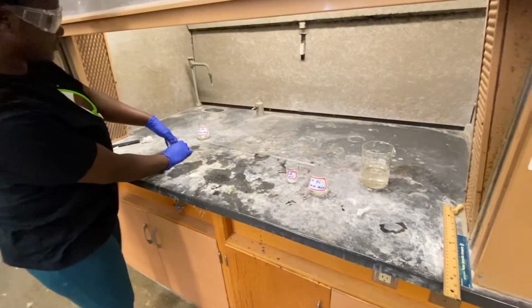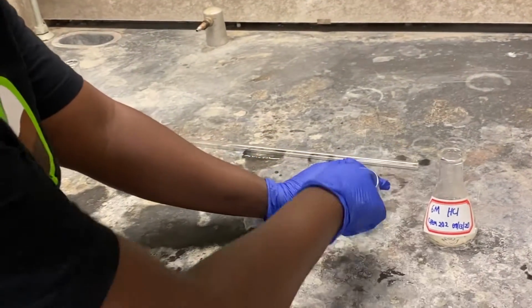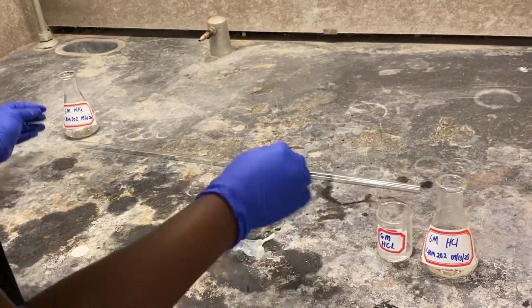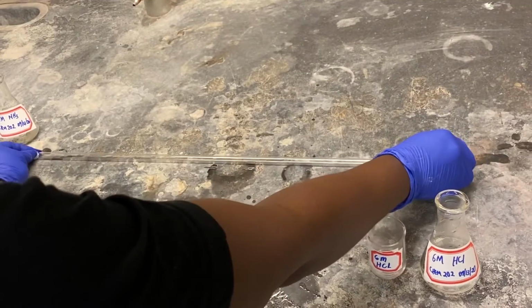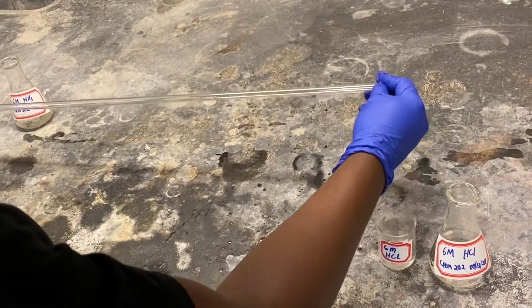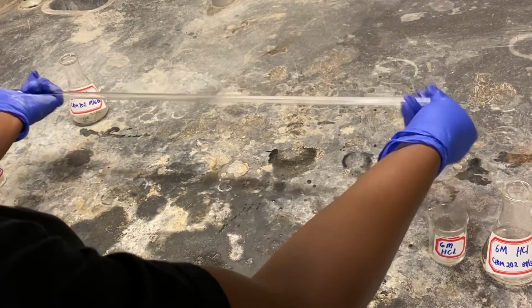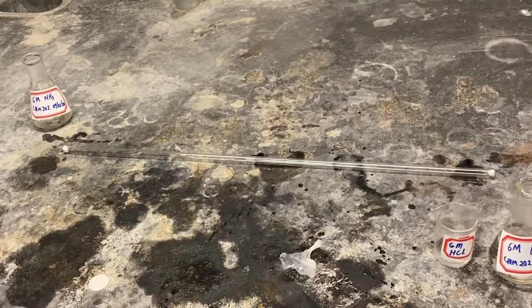So watch as I do this. So I have them in my hand. There you go. So here you go. Let's see what happens after a while.